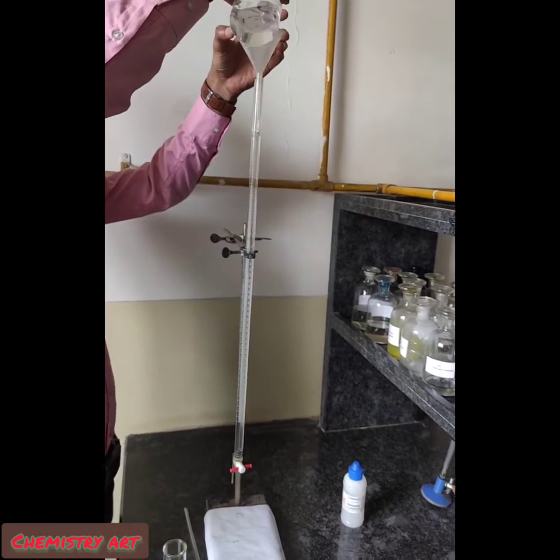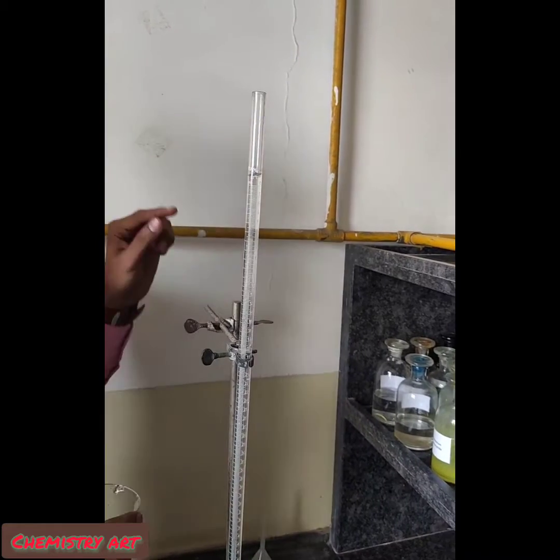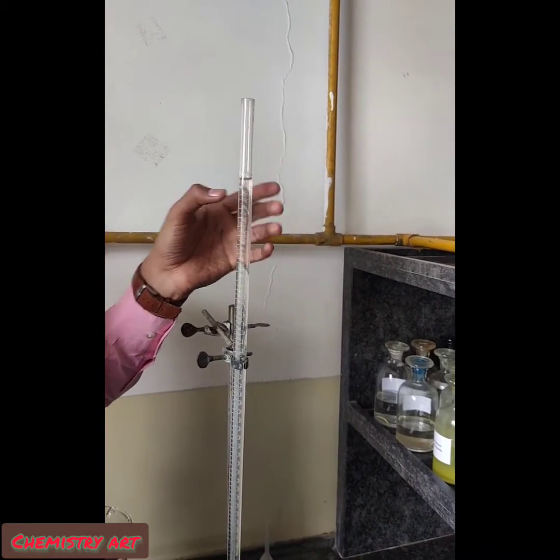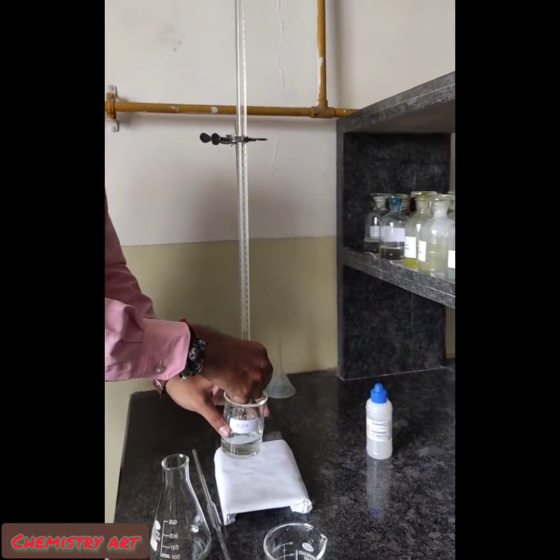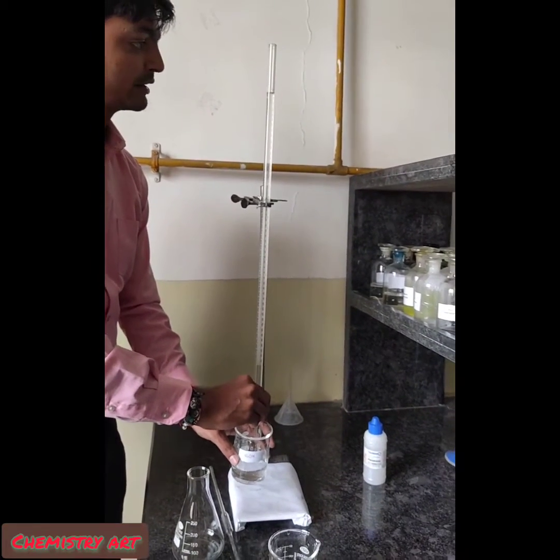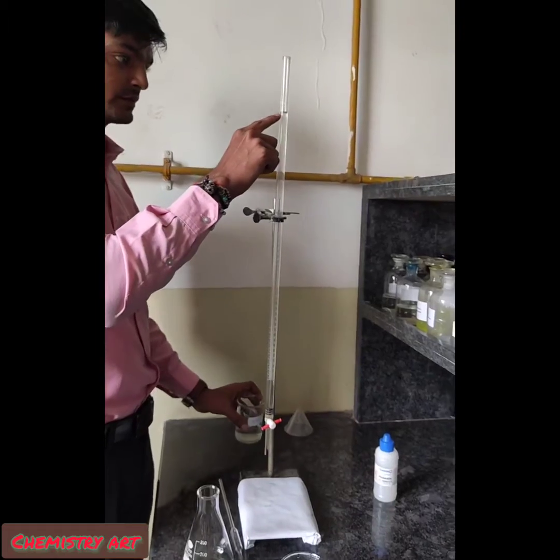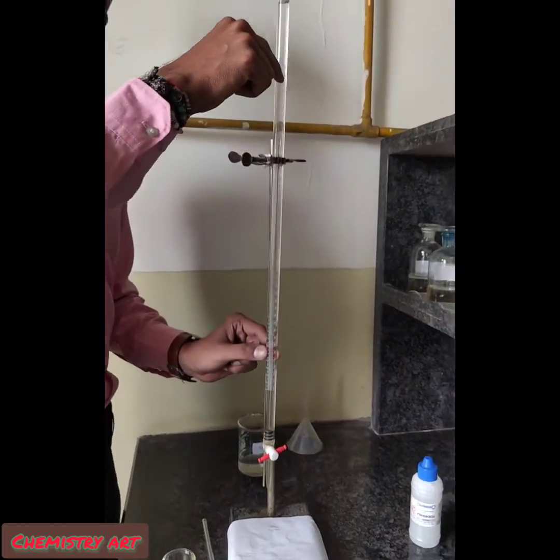Now you have to fill it to zero — add a little more solution above the zero scale, then release the extra solution and match the lower meniscus with the zero mark. The burette should be at eye level so you get an exact reading. Now it is at zero and there are no air bubbles below the cork.